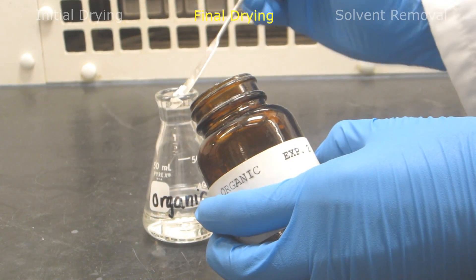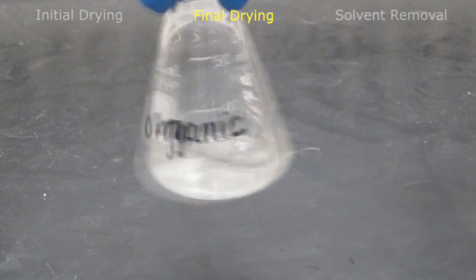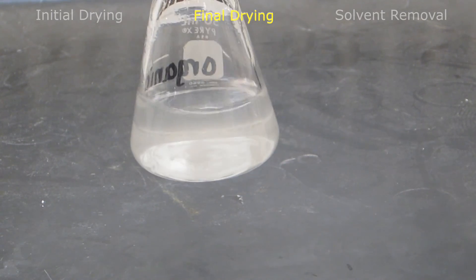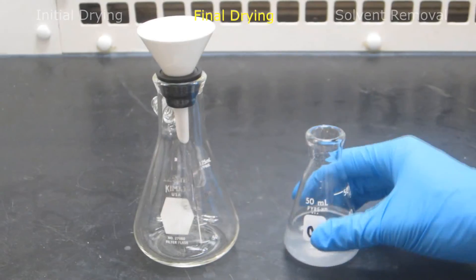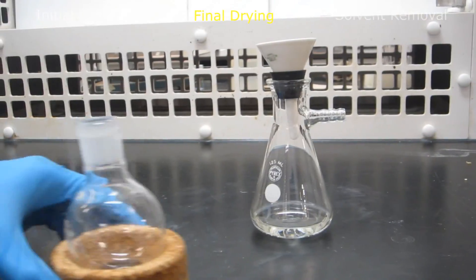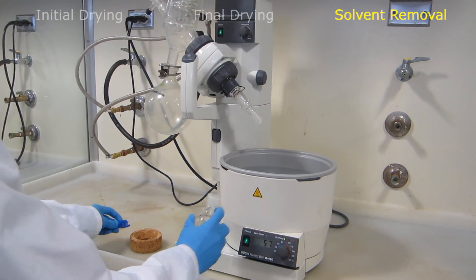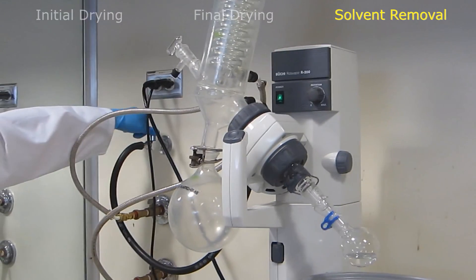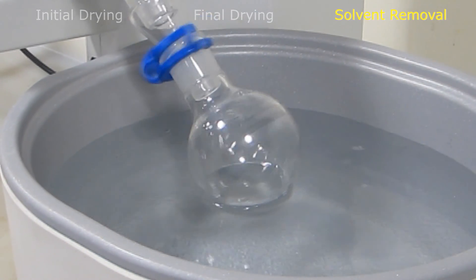Add a spatula tip of the drying agent and swirl. The magnesium sulfate will quickly absorb the unwanted water in the solution, creating clumps in the flask. Once at least some magnesium sulfate is free flowing, no more needs to be added. The appearance of the swirling solution should resemble that of a snow globe. The drying agent is now filtered using a filtration apparatus and either a Buchner or Hirsch funnel. The collected solution is transferred to a pre-weighed round-bottom flask. Finally, the solvent is removed from the desired organic compounds using a rotary evaporator. Once the solvent is removed, the mass of the crude product can be recorded.